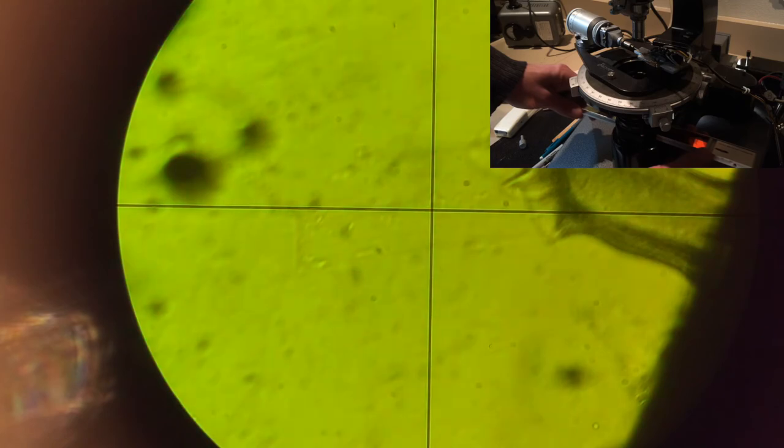Once I can tell, you can see here in the red light, you could probably make a measurement here if you wanted, because I could barely see that crystal now. In green light, I can see the edge of it pretty easily, so it's not matching there. Now it's starting to get there in orange light.